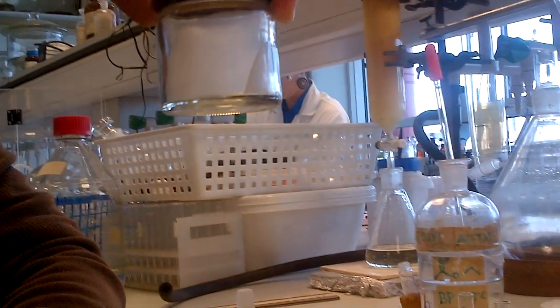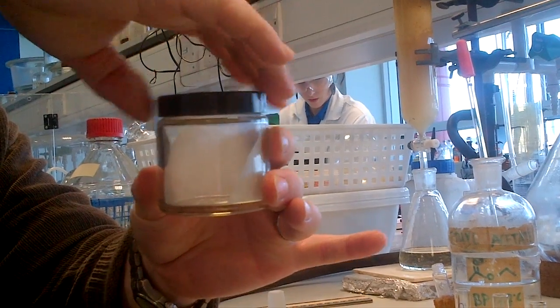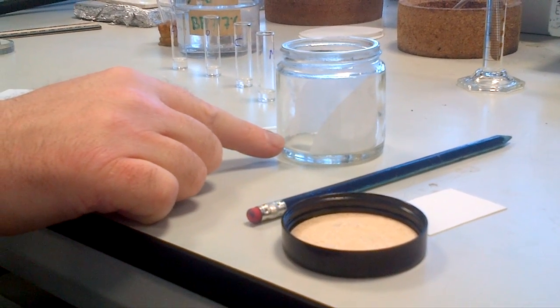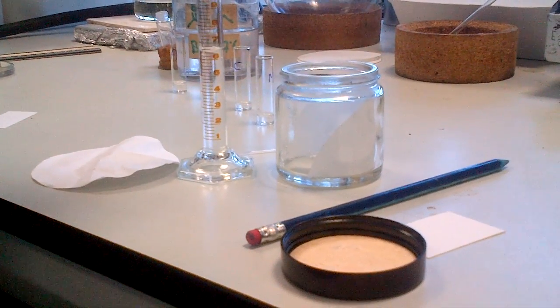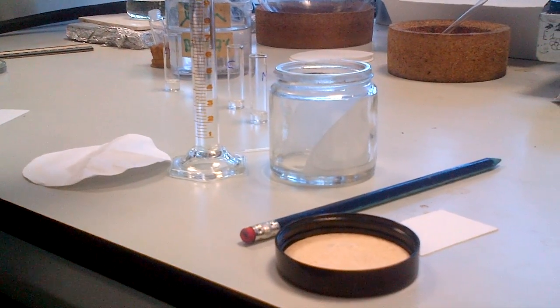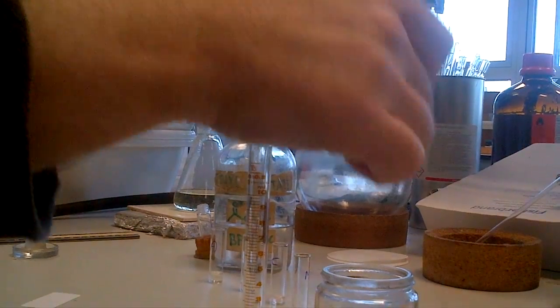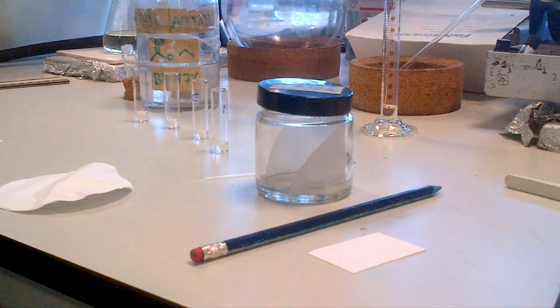We then need a clean solvent tank with some filter paper at the back. The filter paper will help to maintain a saturated environment. Fill to about a depth of one centimetre at the bottom of the tank with the appropriate solvent as specified in your laboratory guide — you'll probably need about seven to eight millilitres. Then put the lid on the container to help maintain a saturated environment.